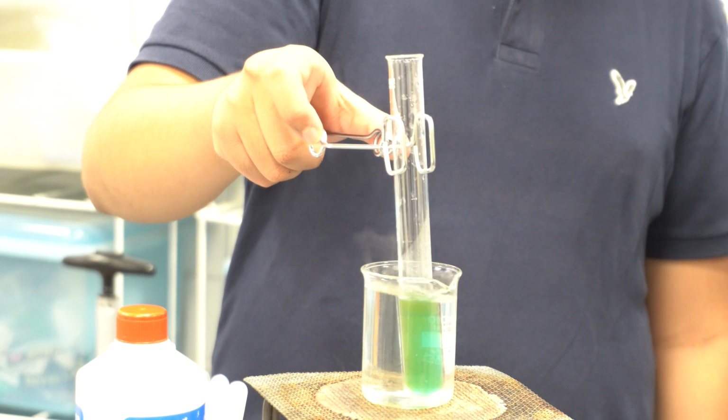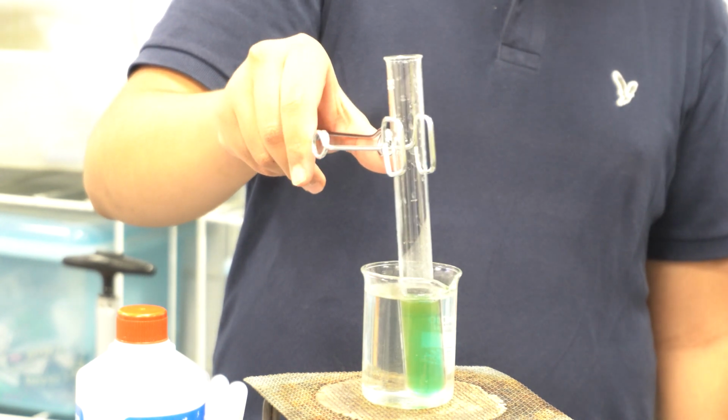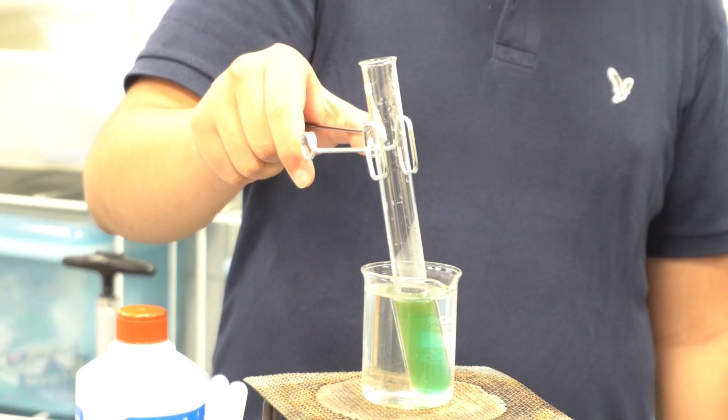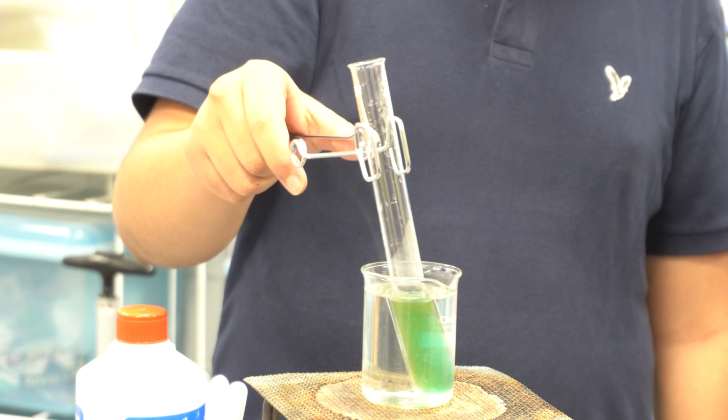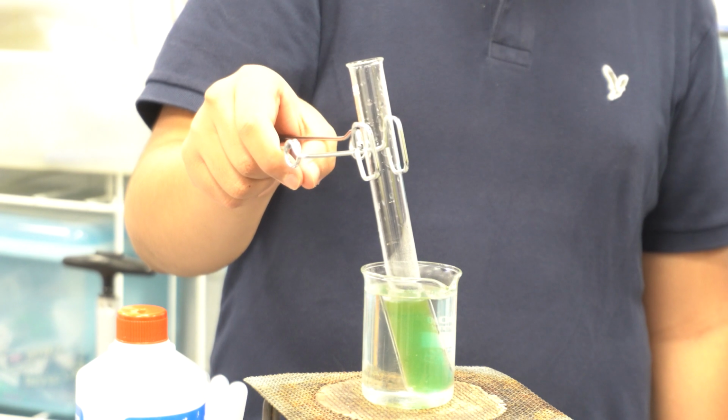And if we keep it for a couple of seconds, it will become yellow. And now the yellowish color is made. After that, it will be converted into orange, and after orange it will become brick red. We can see this now.